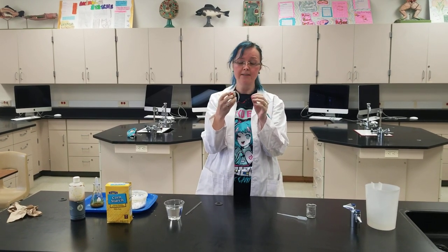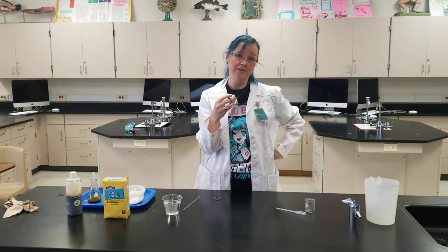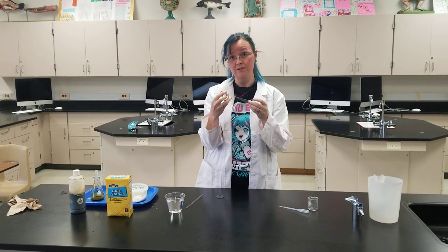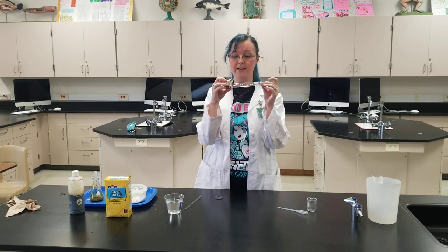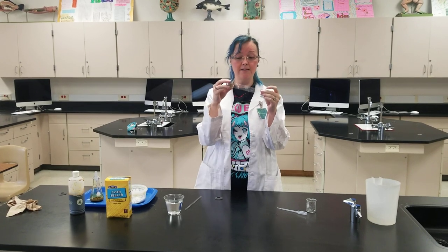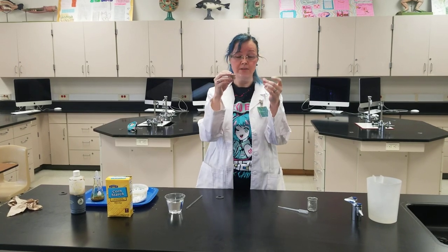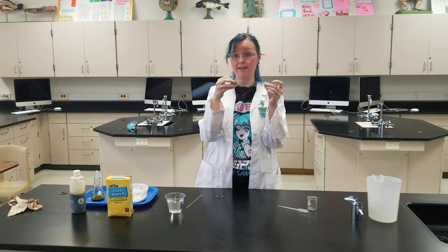Dialysis tubing is really useful because it operates as a semi-permeable membrane, just like the cell membrane as we've talked about. If someone needs dialysis, it means their kidneys aren't working, so they need some way to filter out their blood, and a machine has to do that instead. The reason we're using this dialysis tubing is because it's semi-permeable — it's not going to let stuff like germs get in, but it still allows things like oxygen to go through, keeping the person's blood healthy while the machine is cleaning it.